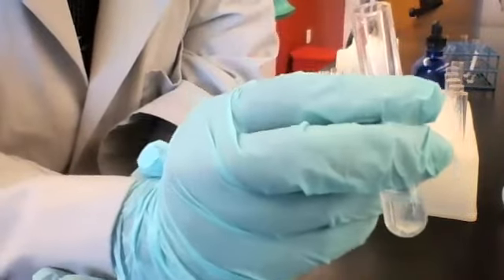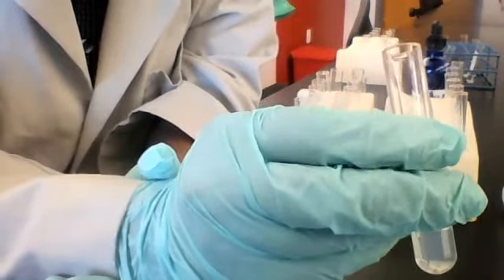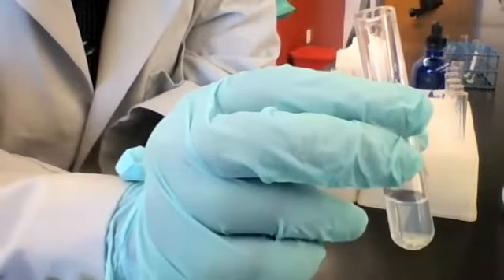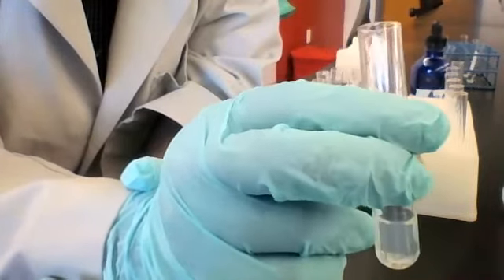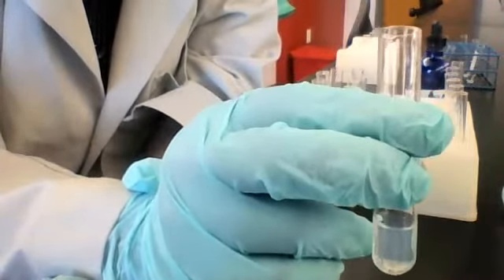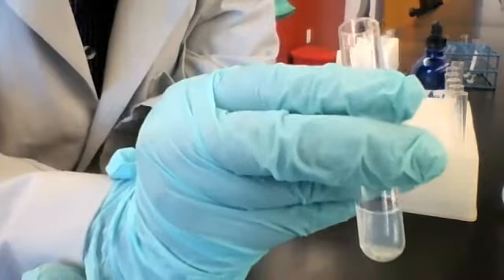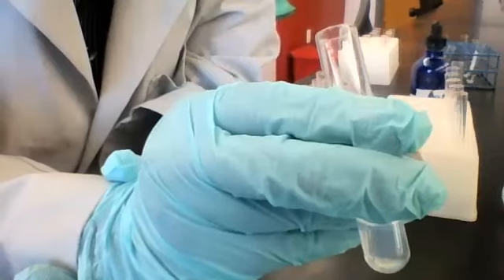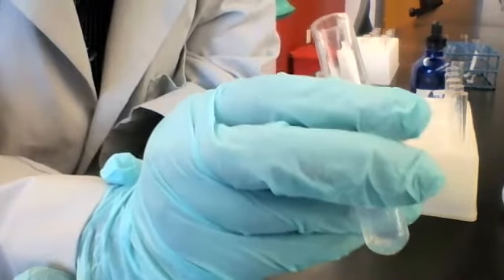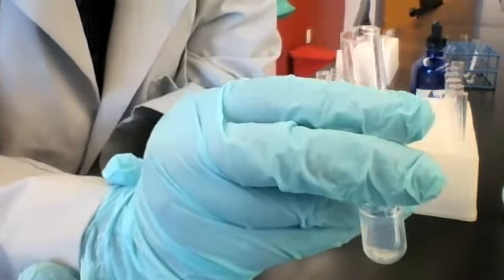It's an aqueous solution, meaning the only thing in it is silver nitrate dissolved in water. So when I add it to more water, I'm not expecting anything to happen except that the solution will become more diluted. Does that make sense? In other words, if you add water to a solution, it should not magically form a precipitate. All water can do is change the concentration of whatever solution you're adding it to.